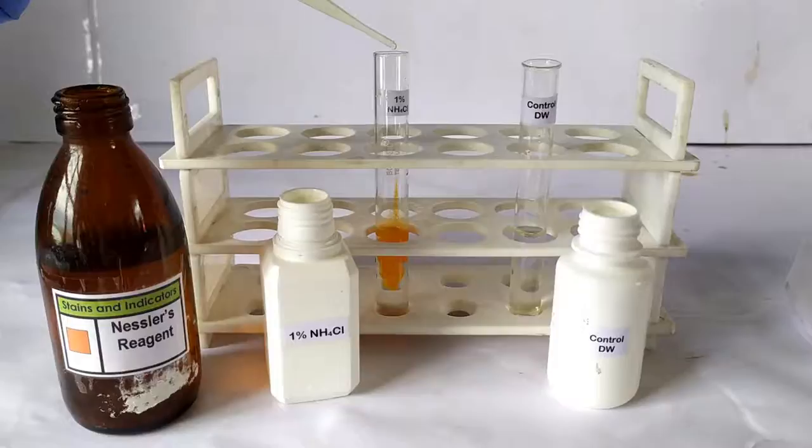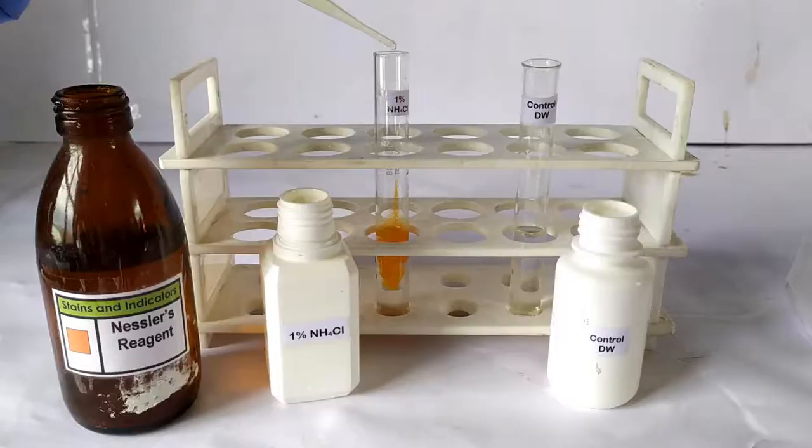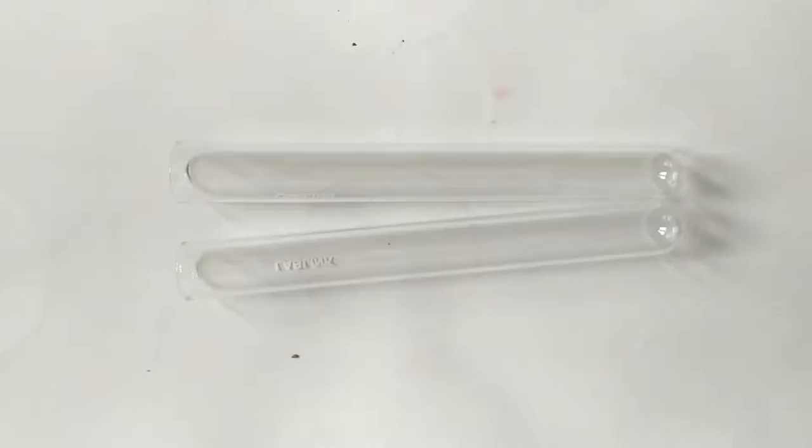In this video, we'll be performing the Nessler's test on a sample either containing ammonia or suspected to contain ammonia or ammonium.